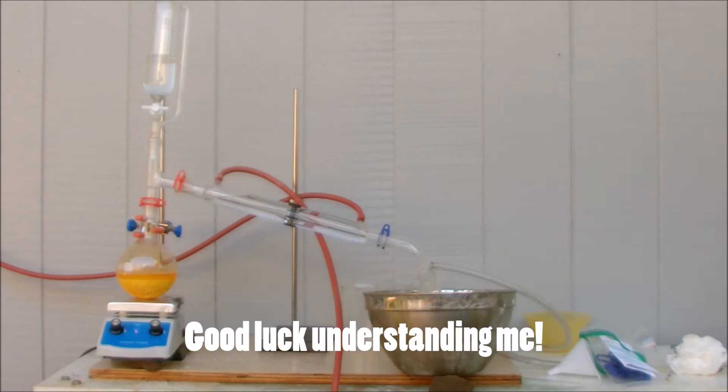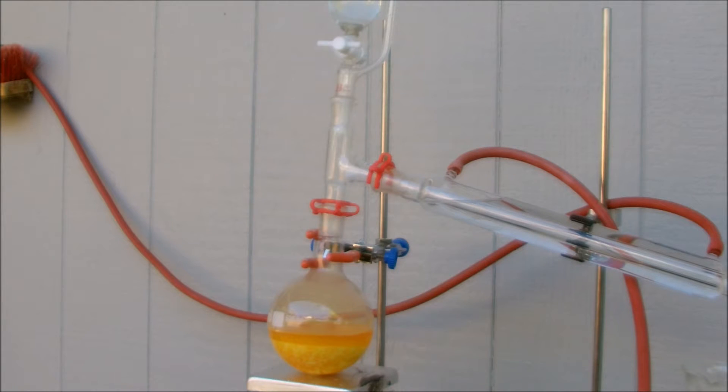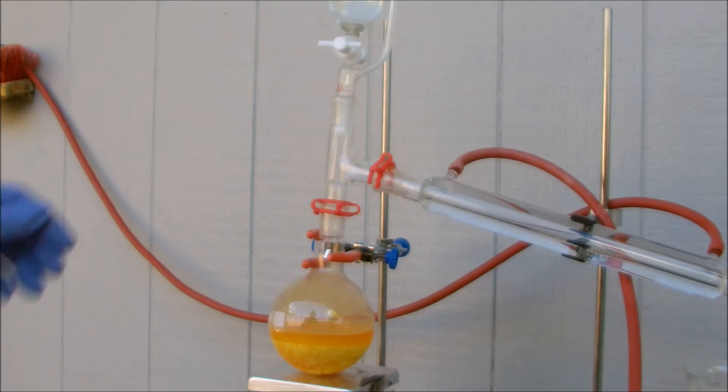Now we're going to turn on the flow of the condenser and start adding the hydrochloric acid.